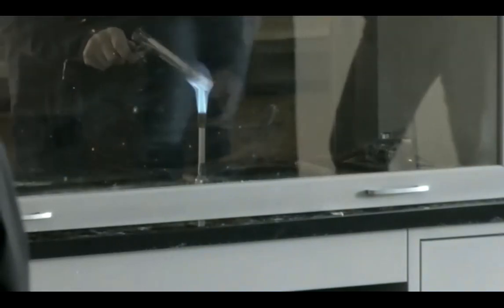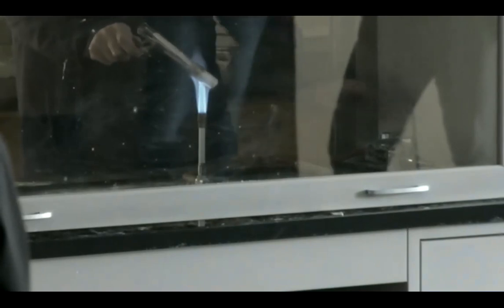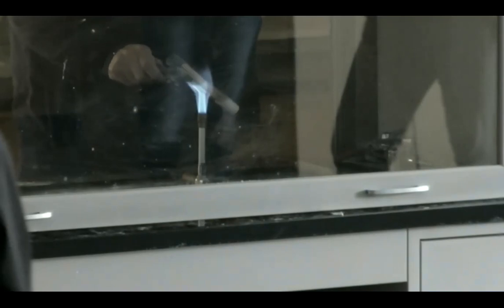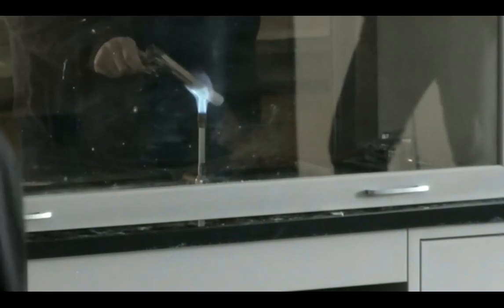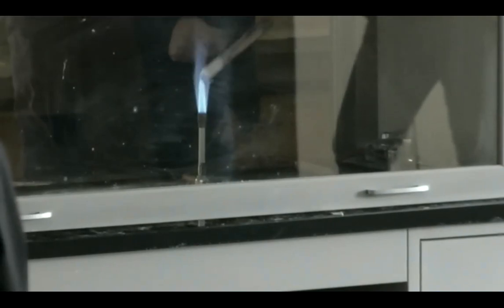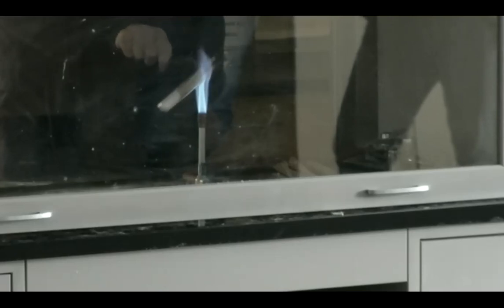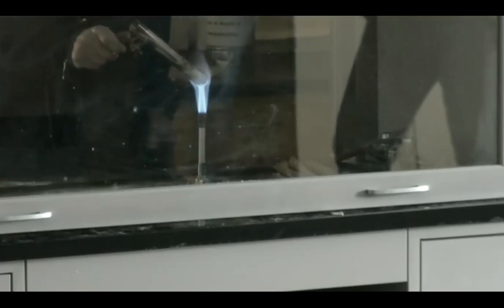All right. So once again, it will take a minute or two. If you heat the glass evenly, it's way less likely to crack. In my career, I've broken one. In Bert's single day of teaching this, he breaks 5.